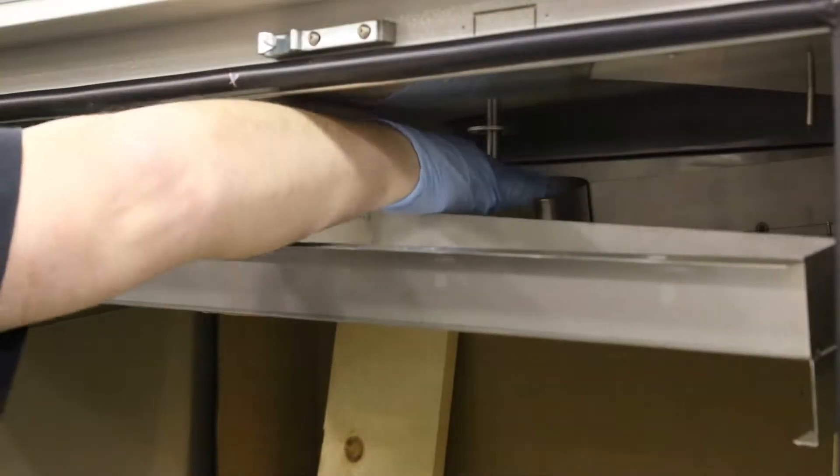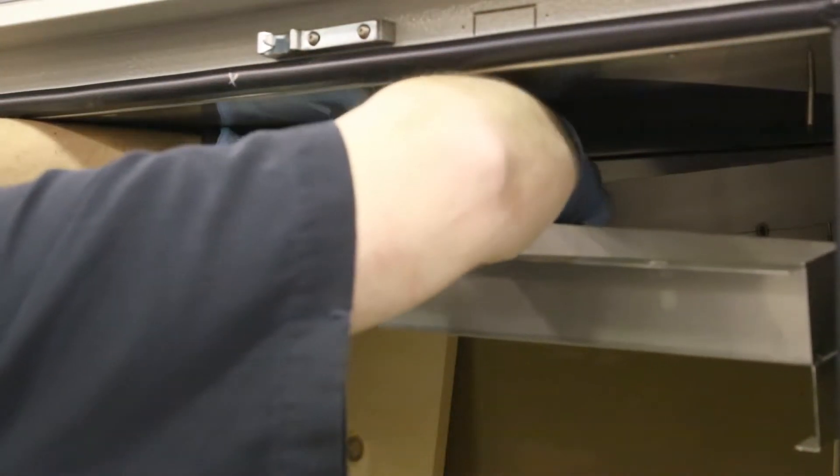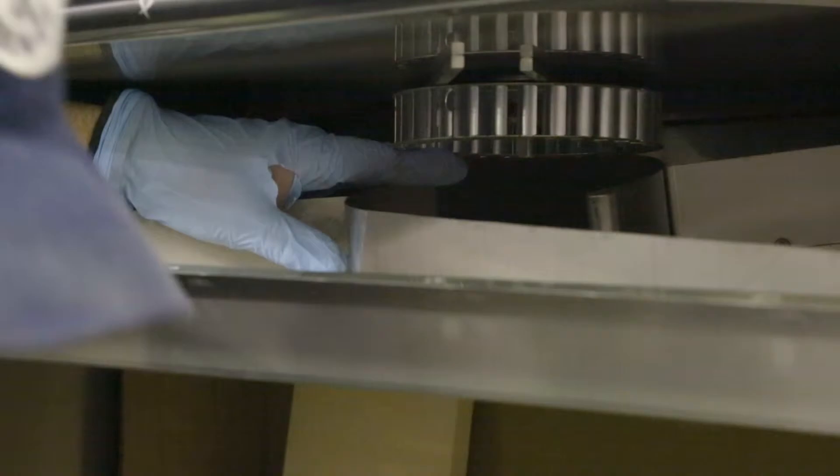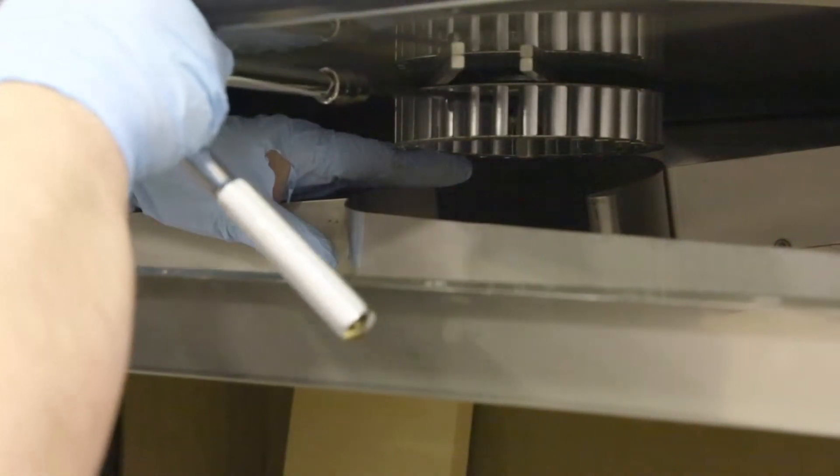Find the flat part of the motor shaft to align the fan wheel. Place the key stock on the fan wheel and slide up until tight. Then tighten the two set screws to secure the fan wheel.